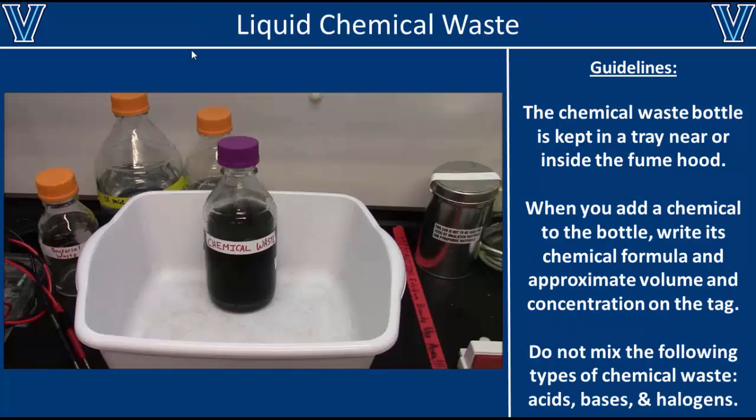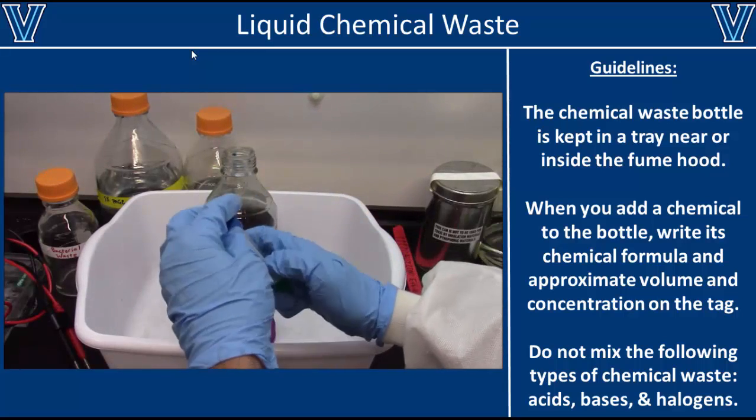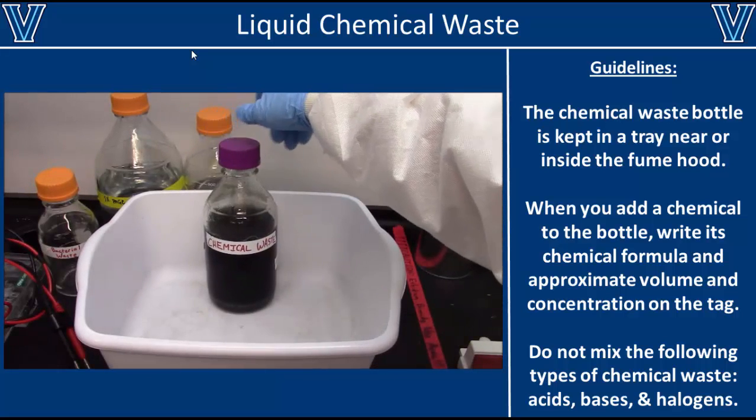The most common type of waste you'll generate is liquid chemical waste. This could be an acid or base solution, maybe even a dissolved metal. In any case, liquid chemical waste should be collected in a glass vessel with a lid. These chemical waste containers are usually kept inside or very near the chemical fume hood.